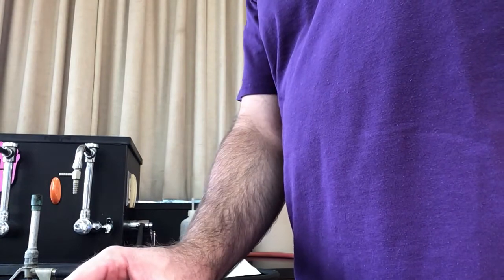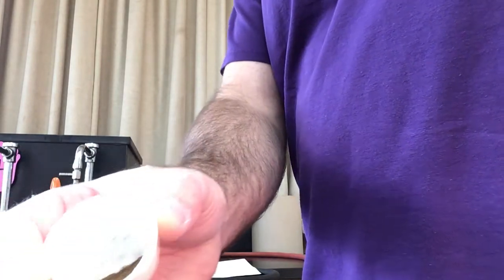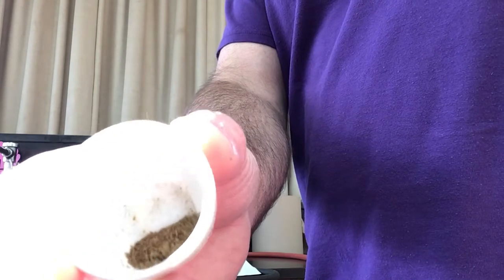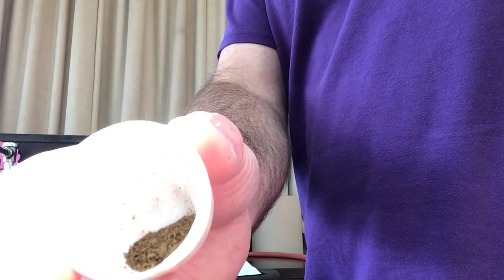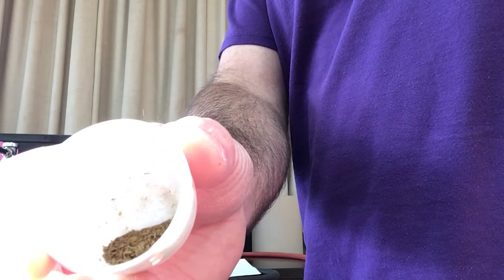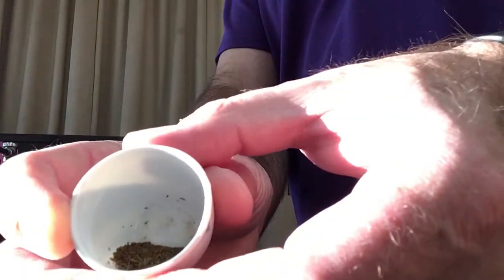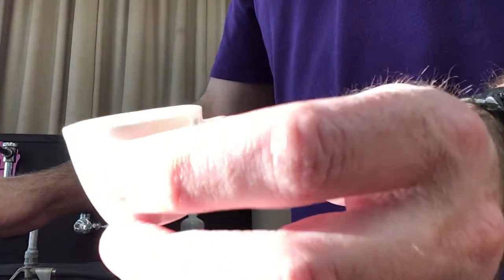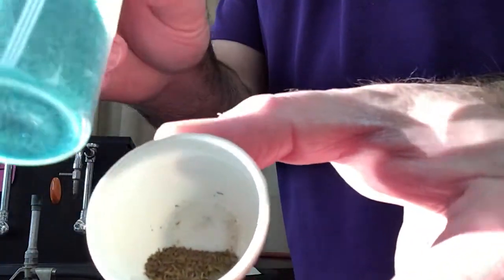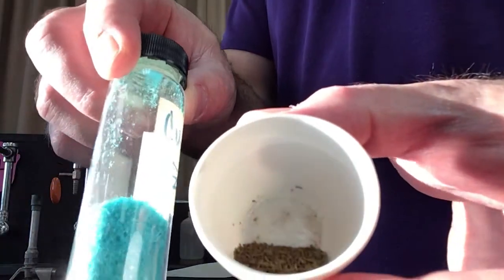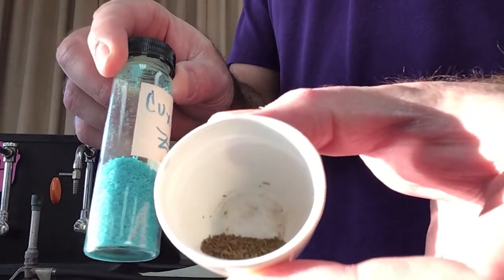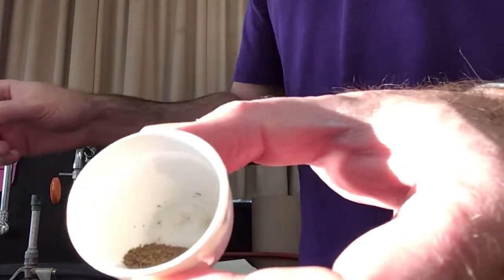We're back and this is what the copper anhydrous, the anhydrate, looks like. You can see a big difference in the color from what it started out as. Here's definitely more of a tan kind of color, and then here was the green stuff. Definitely a big difference there.